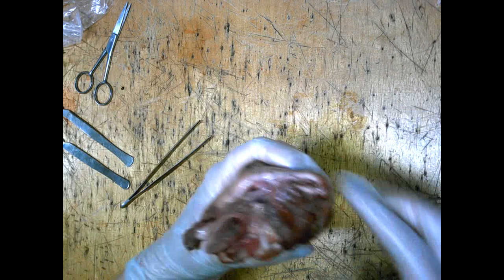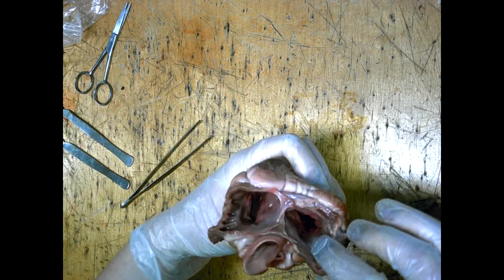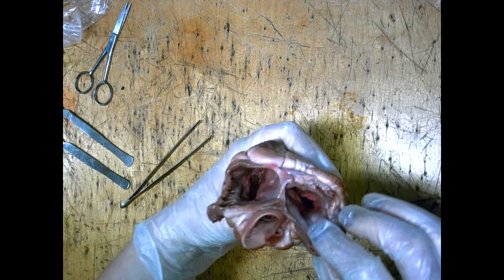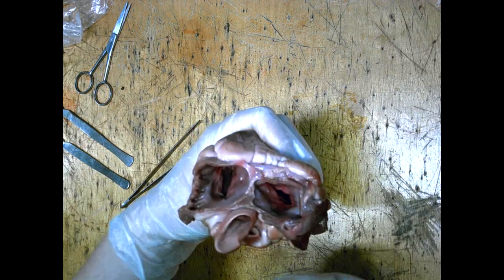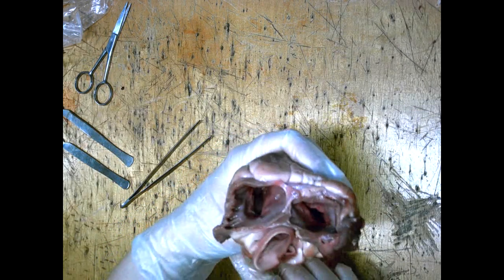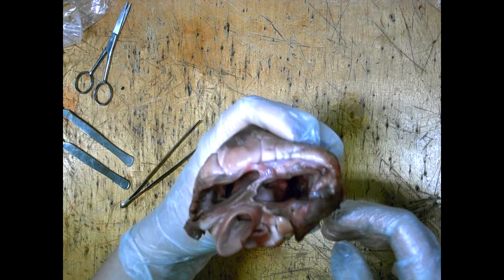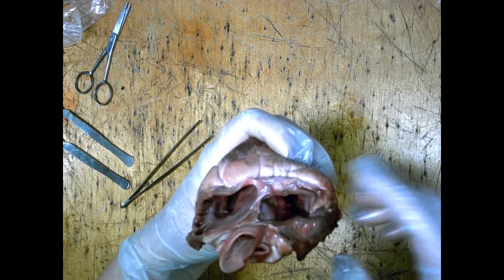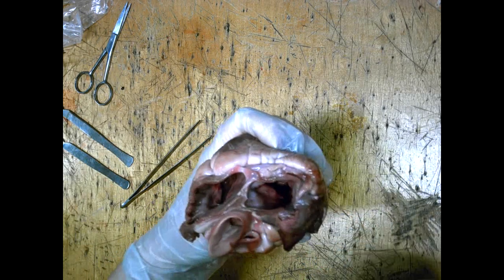We can clearly see that we have the two atria. The atria are fed by the veins. The vena cava has returned blood from the body and enters into the right atrium. The pulmonary vein returns blood from the lungs after it's collected oxygen and enters into the left atrium.